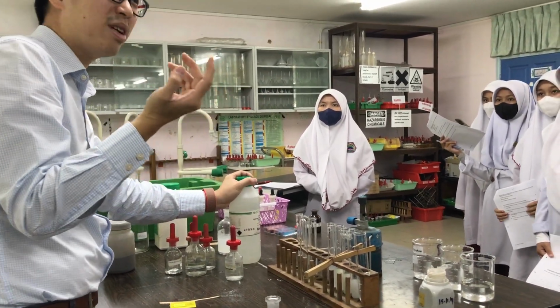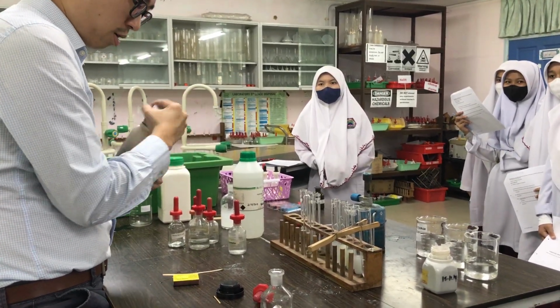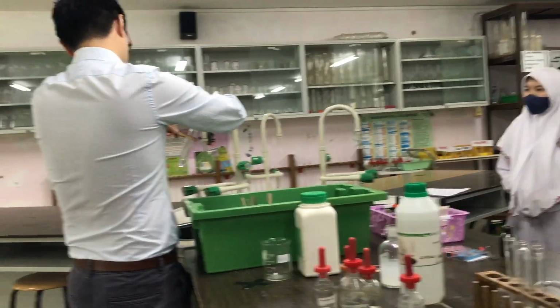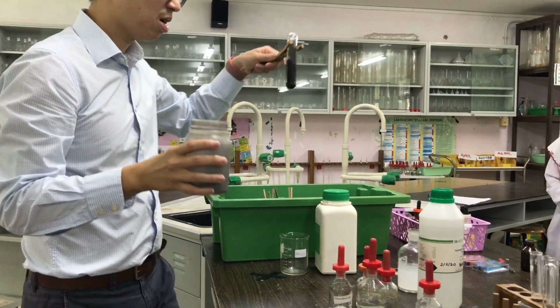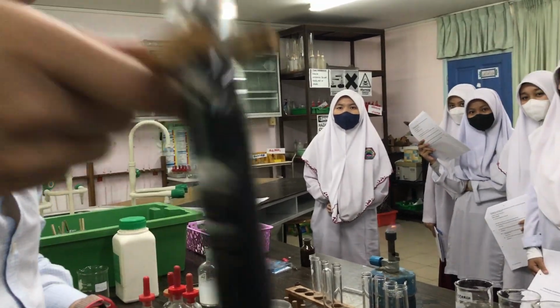These are all in the rate of reaction, guys. There was a few months ago, yeah, and it was face to face, okay? Anyway, this is a compound which I can add and it will speed up the rate of these reactions. Okay, what do you see now? What do you see now? Bubble. Can you hear it? Yes. Of course, you see first.